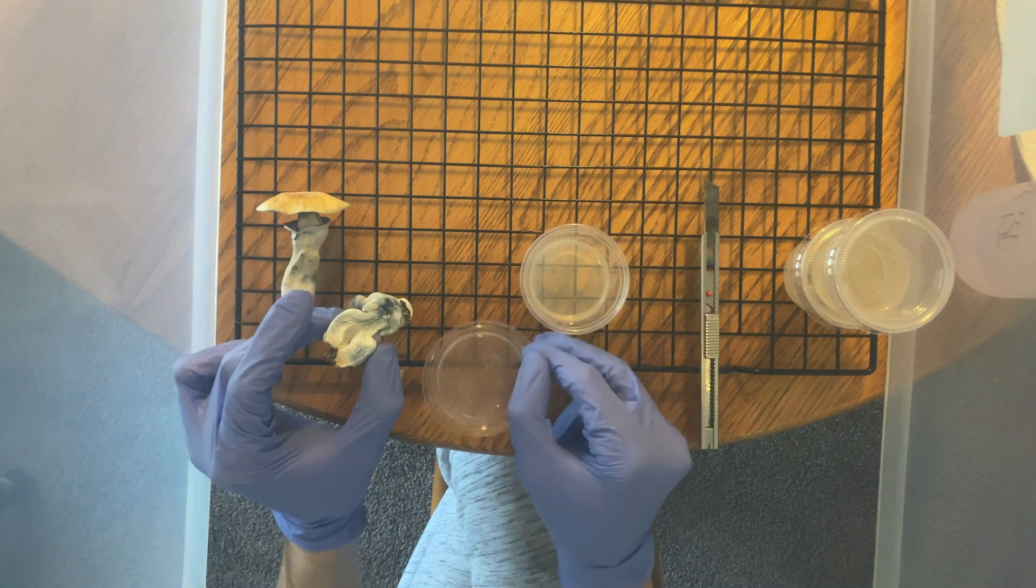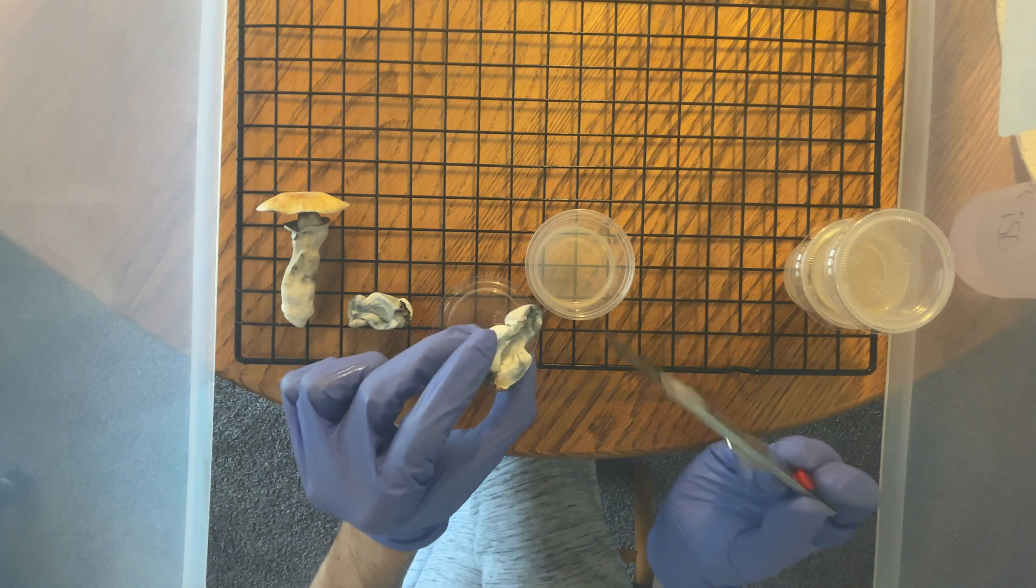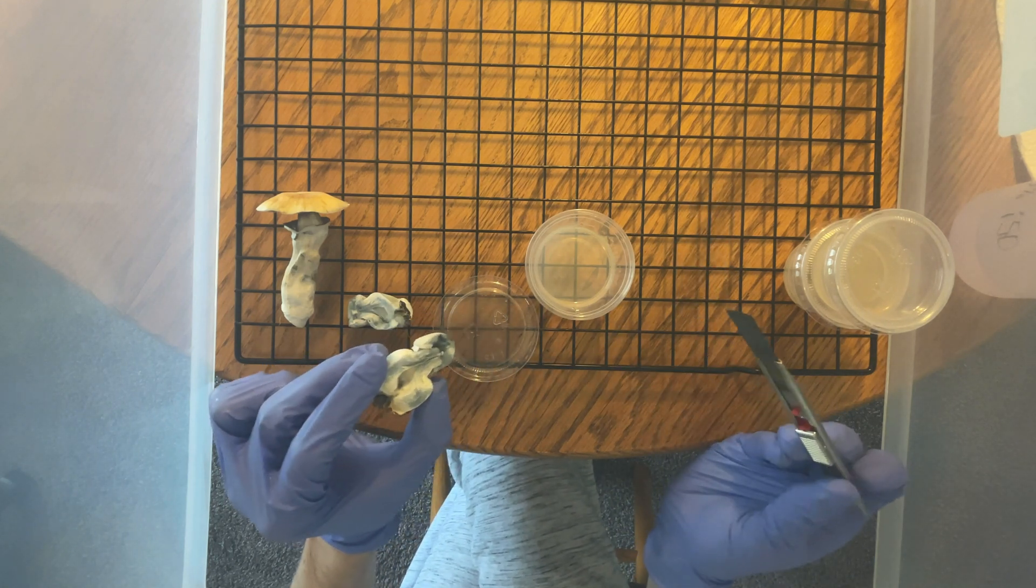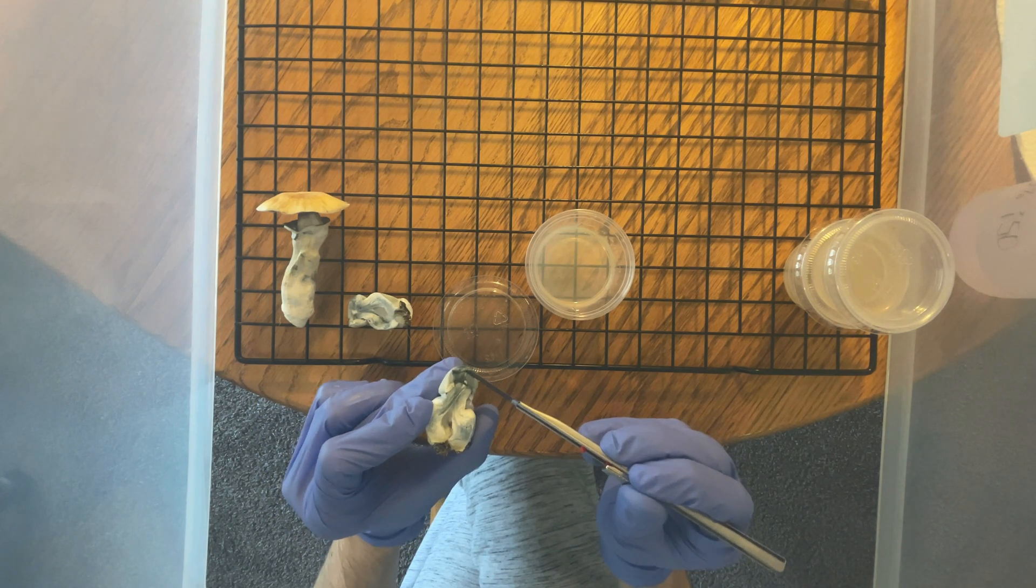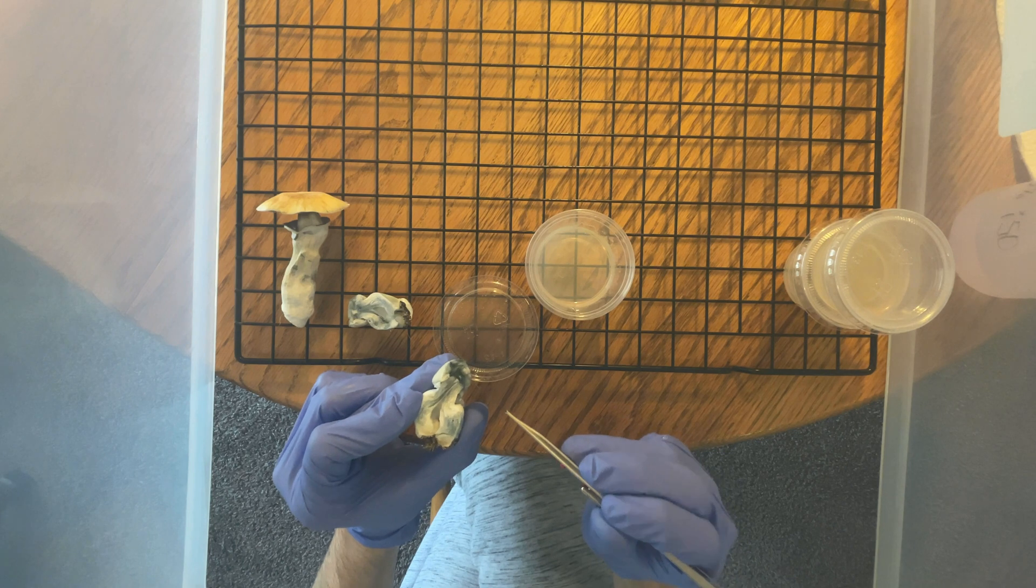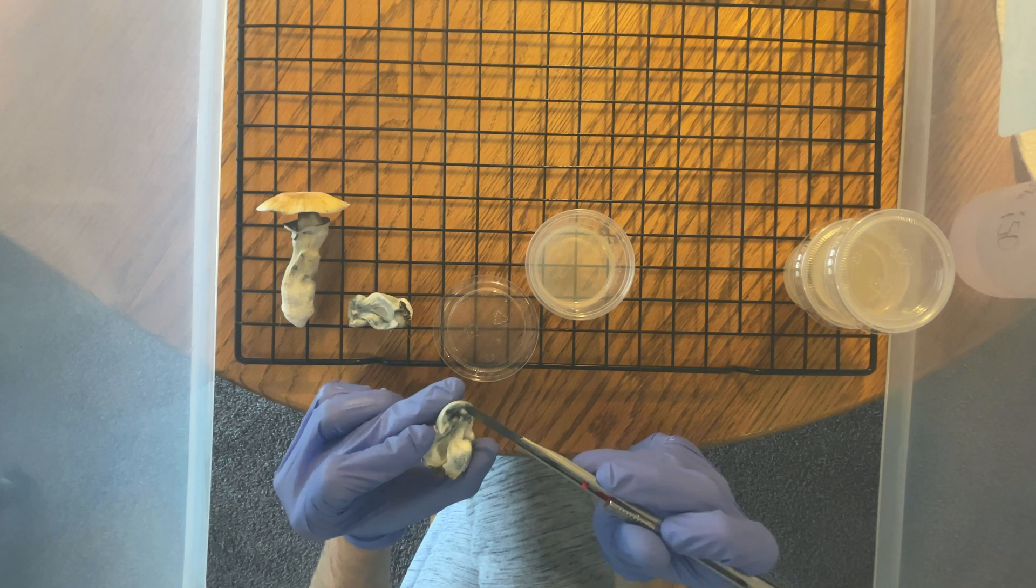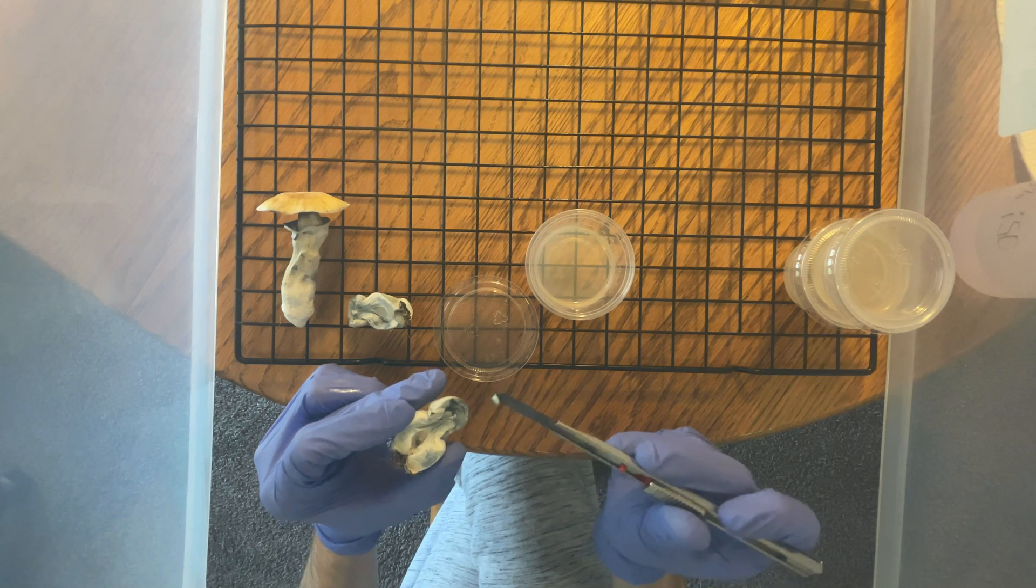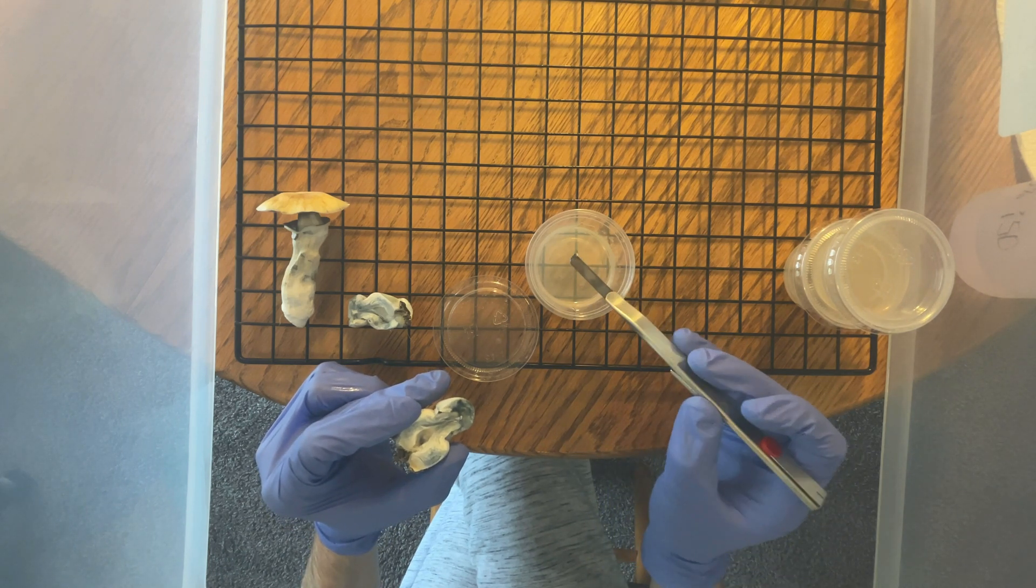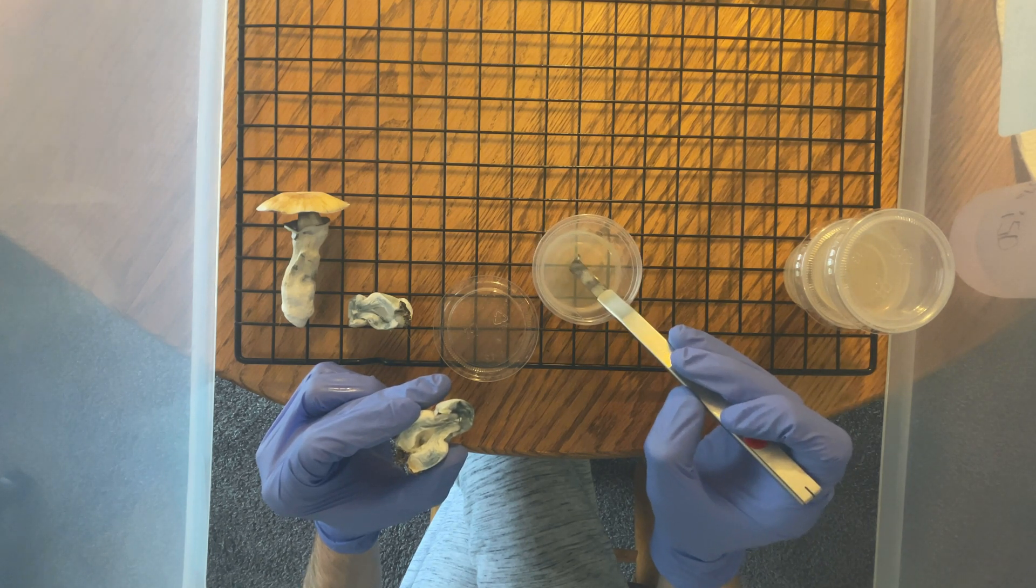And it falls off. No sweat, I don't really mind. And once your transfer is on the agar, you just want to close up your dish as fast as possible in a smooth, slow motion, just so that nothing else makes it onto the plate.